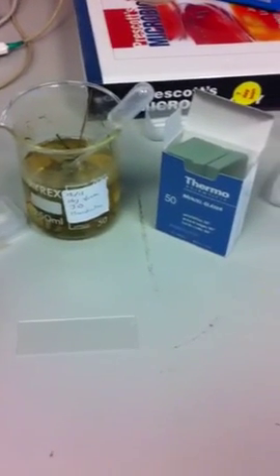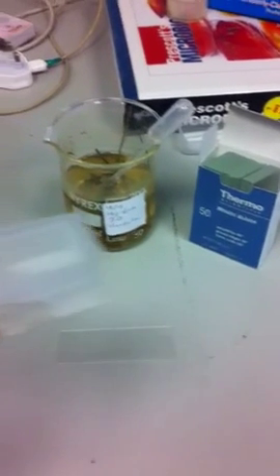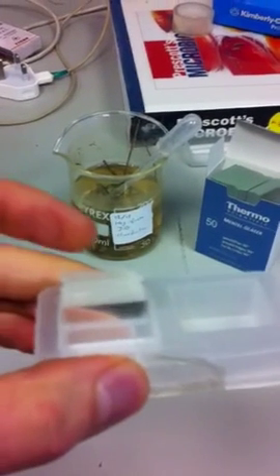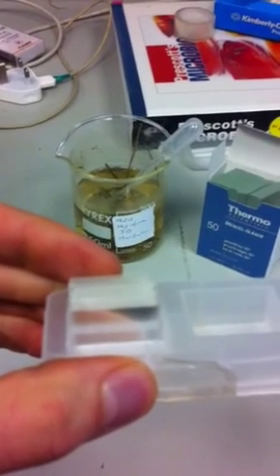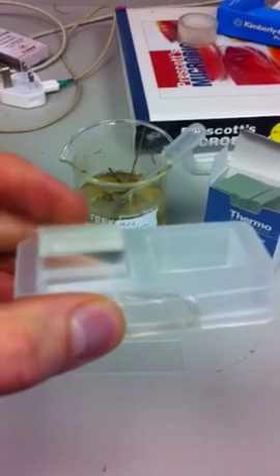We've also got cover slips. These are what you actually put on top of the slide once you've put your sample onto it.